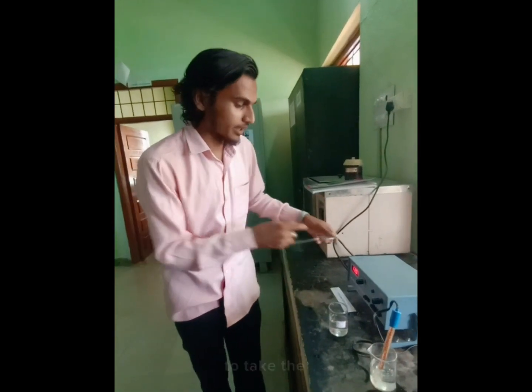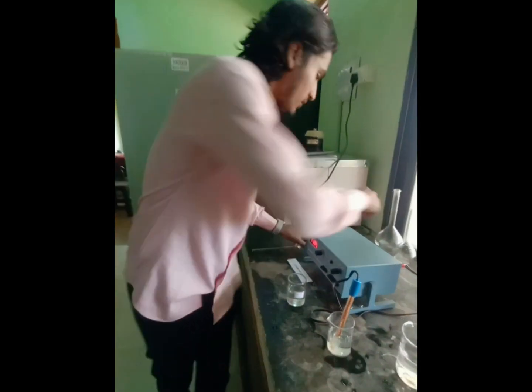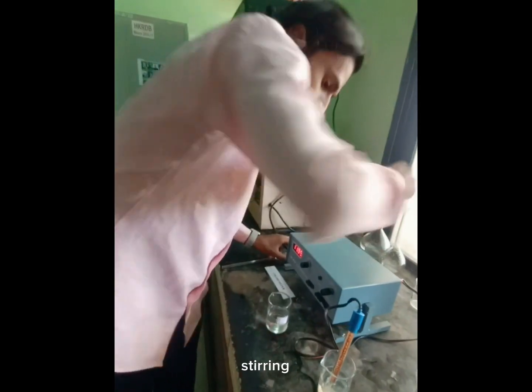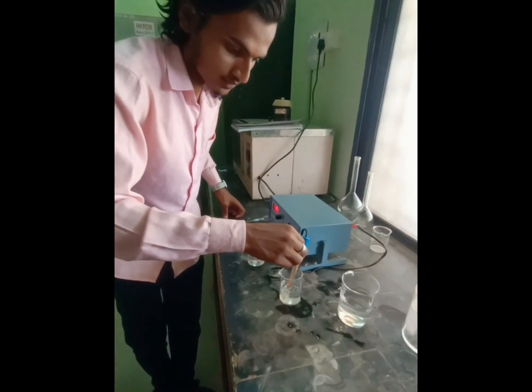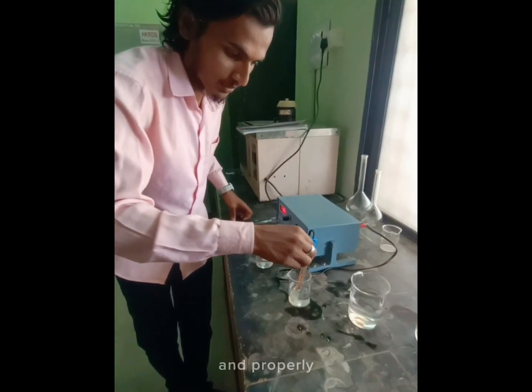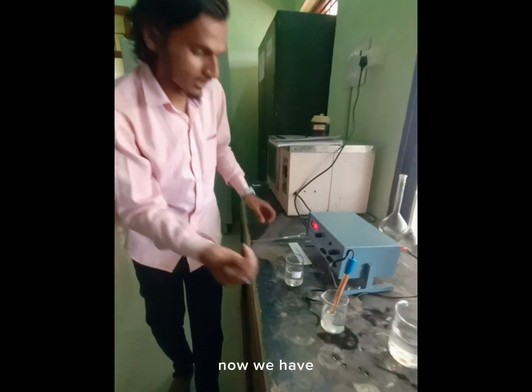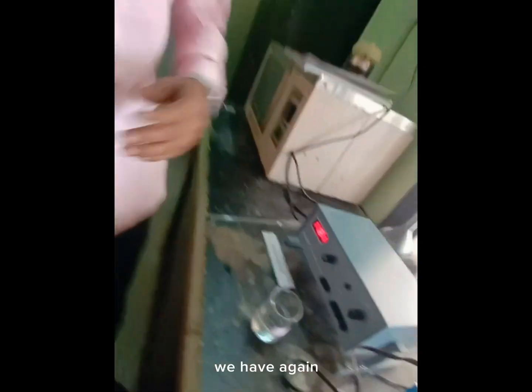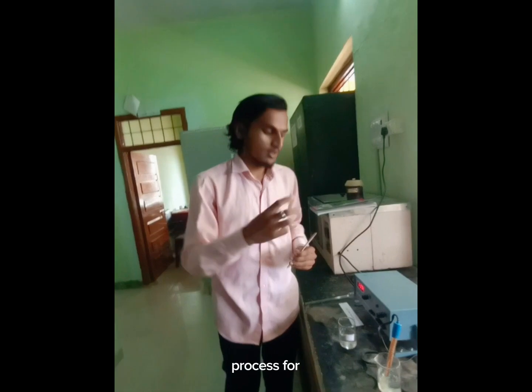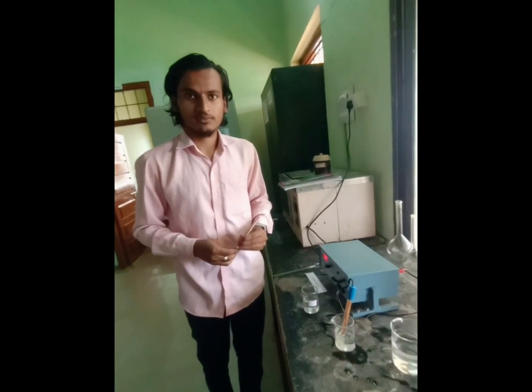We have to take the readings by stirring with the glass rod in a proper manner. Now we have to take the readings. Again, we have to repeat this process for the next three times.